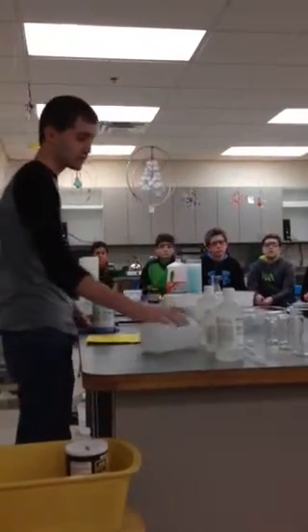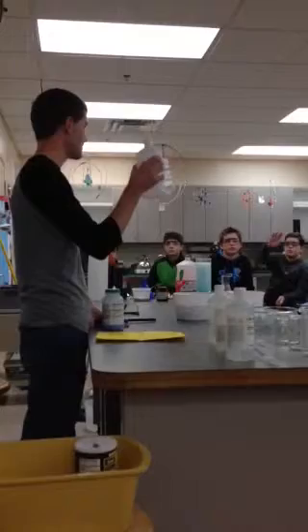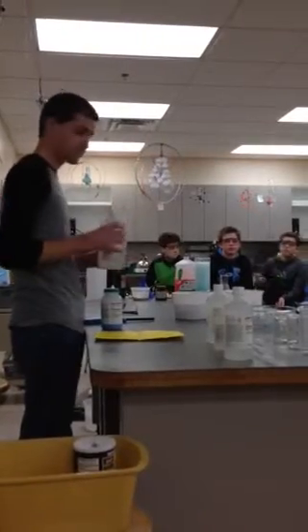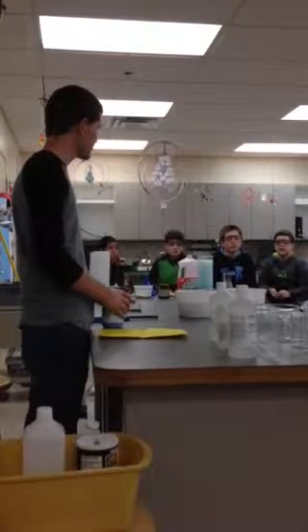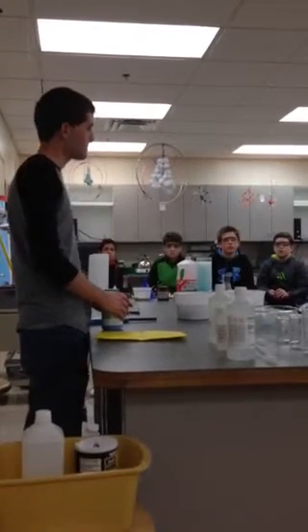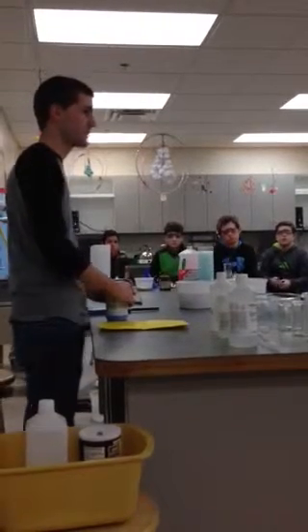Because isopropyl alcohol, I'm glad you had the lid on that, does not make a green flame. Because blue and then like the fire's kind of yellow. Okay, you think the colors are combining. That's a good thought. There might be a little bit of that involved, but that's not the main reason.